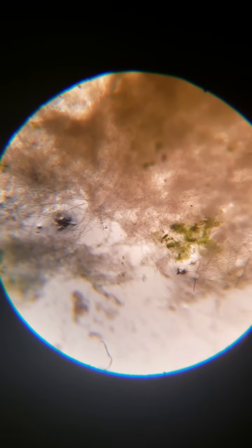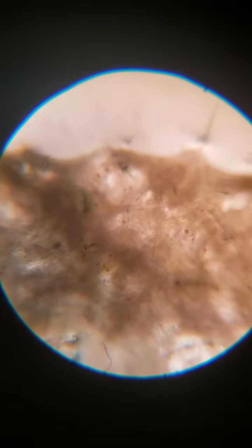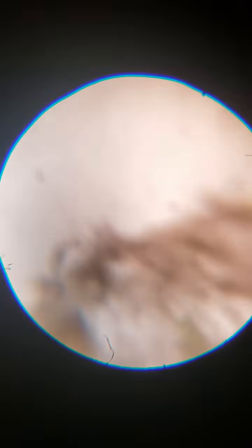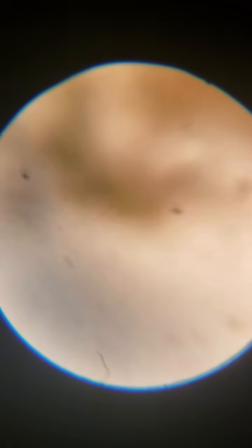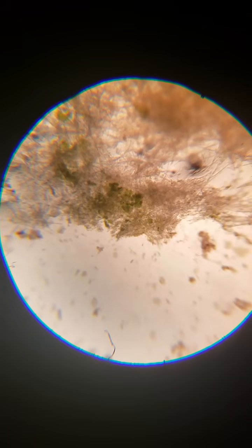But it's different for every species. So just take a look at that for a second and look at the dark hole in the center there, which is basically just a hole, and that is how the sponge just sits and waits and builds like a spider web and catches all the stuff that floats by.